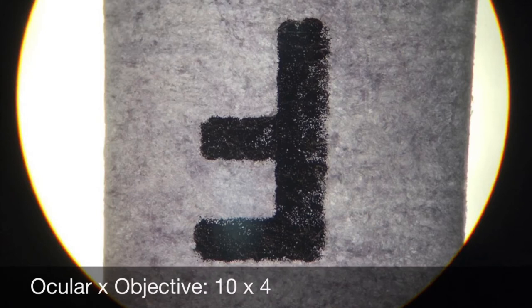Look at your lab report. In a compound microscope column, draw the image of F observed under the microscope. Make sure you record the magnification in the lab report.